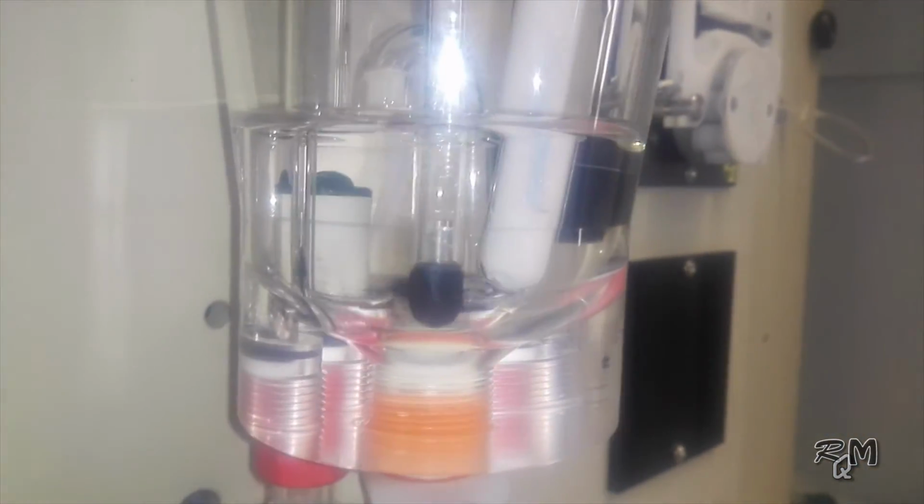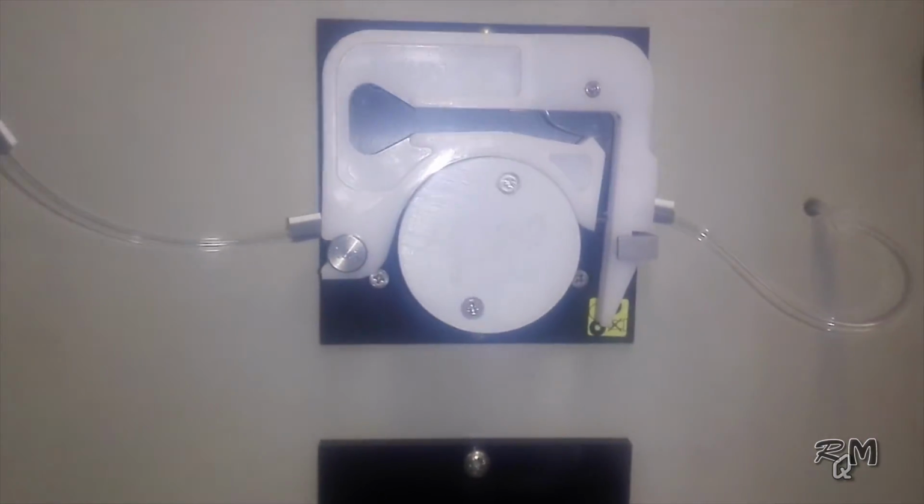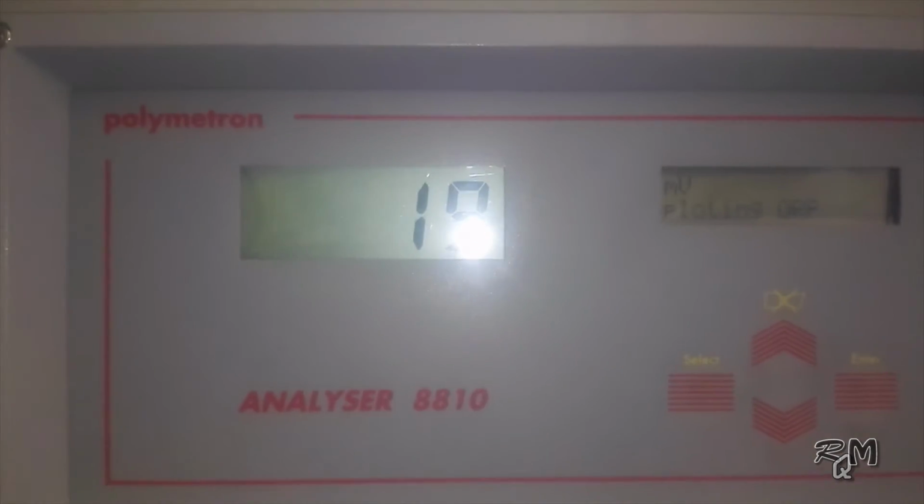Then the sample inlet valve will close and the siphon will activate to maintain an accurate volume of sample. Then the stirrer will come into action. After 8 to 10 seconds, the conditioner pump will inject the conditioner for 20 to 40 seconds to raise the pH of the sample to 8.3. Plus minus 0.2 deviation is acceptable.